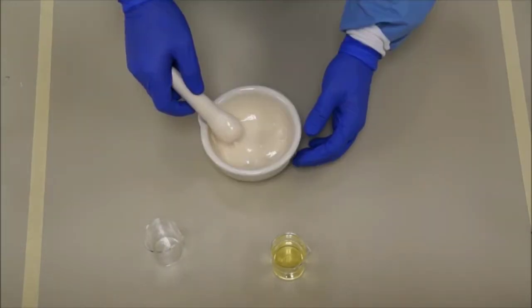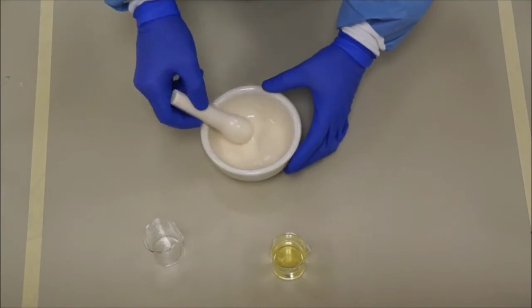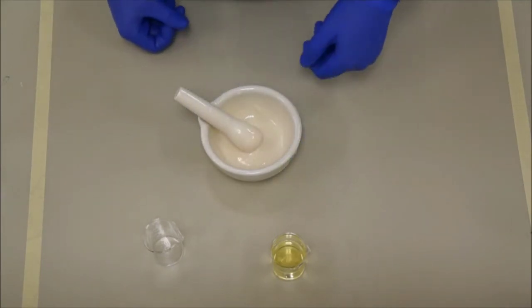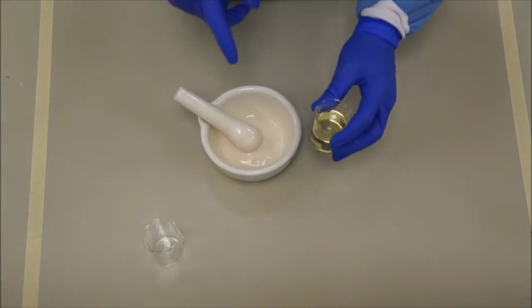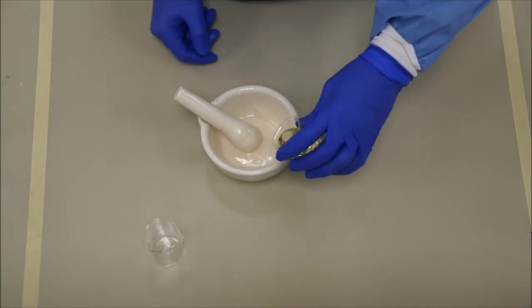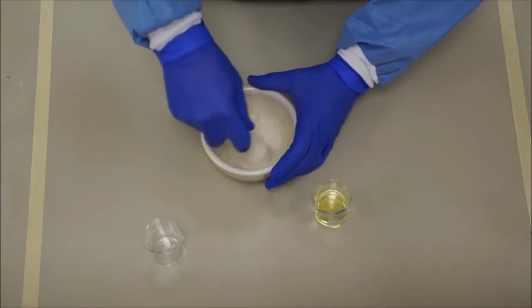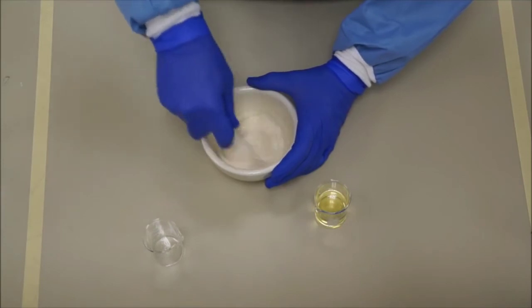The texture should be creamy. After that, you have to add oil, but make sure you add it in parts — first add 10 to 20 ml, then add more, but keep triturating because oil is very viscous and it's very difficult to get it mixed with the acacia.